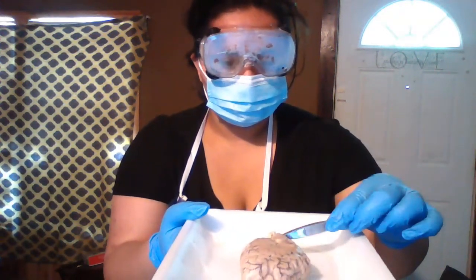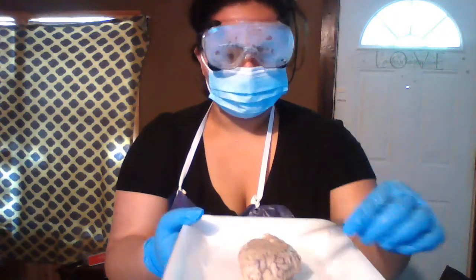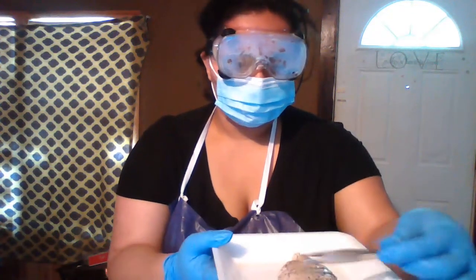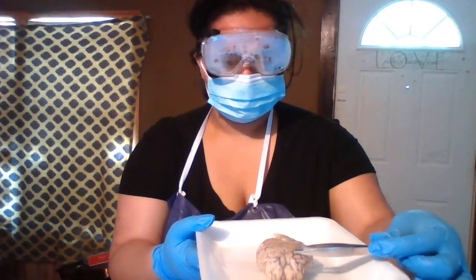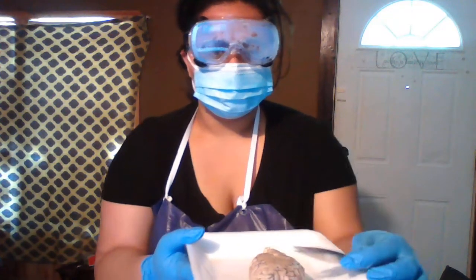The brain stem, since it connects to the neck, is of course the back, posterior. The frontal lobes, it's a given, it's the front. The frontal lobes look like they're a little bigger and have more area than all the other lobes.